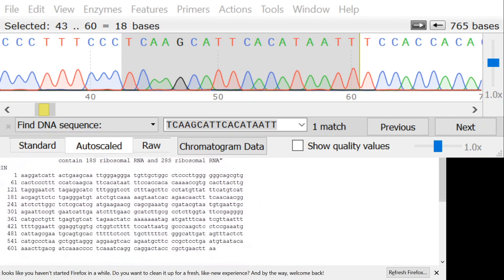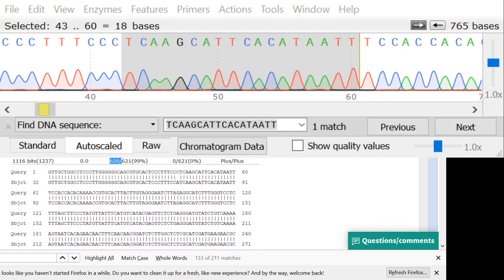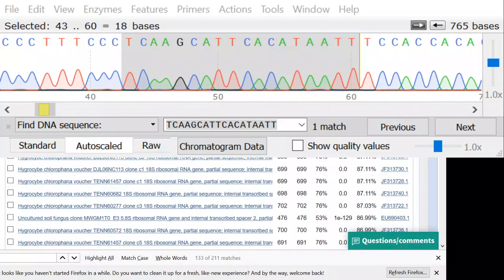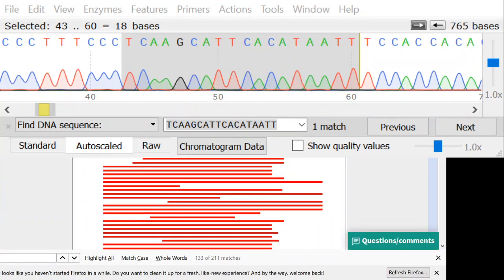Also, a lot of times you look and see who did this data submission. For example, this was submitted by Jean Lodge, and Jean Lodge is actually coming over tomorrow. We're going to work on some stuff, but she is the world expert on Hygrocybe, so I definitely trust her name on here. So I know that Hygrocybe flavescens is a good name for this. Now we've checked to make sure our sequence is good quality, and we know what it is. So the next thing we want to do is submit it to GenBank.